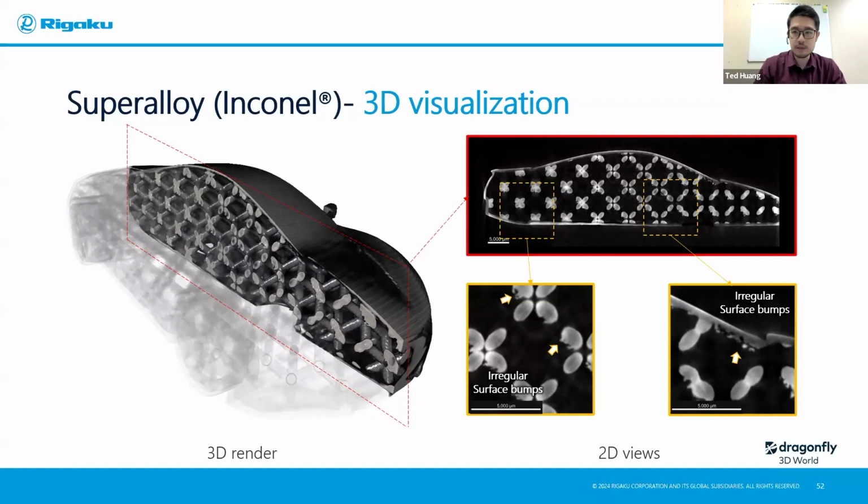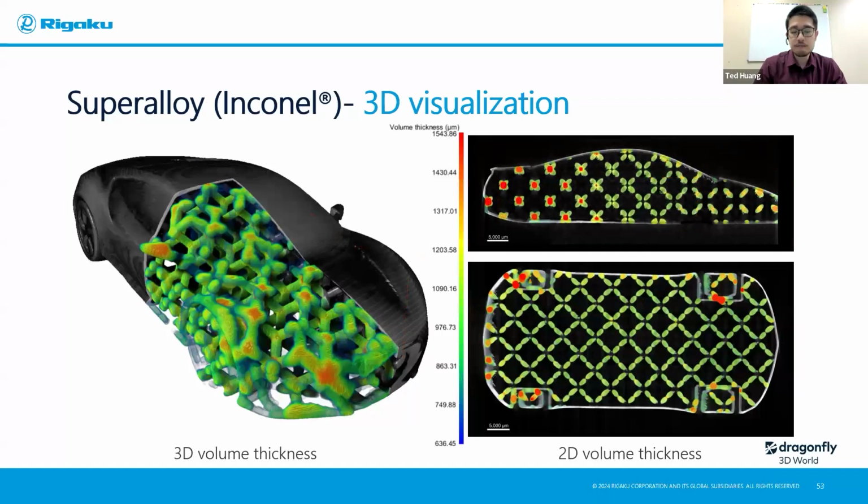And then we can start asking some quantitative questions like, if this car is to be subjected to some loads or some stress, how would the load distribute? Most likely it's going to be related to how thick each of the internal strut structures that you're looking at here is. So I did a volume thickness analysis, both in 2D on the right and 3D on the left. You can have an idea that the thicker area is probably better at withstanding forces. The thinner area is probably not as good. But you have the control of the 3D model that you printed after you scan it. So why not just bring that 3D model directly back into the simulation that you're using?